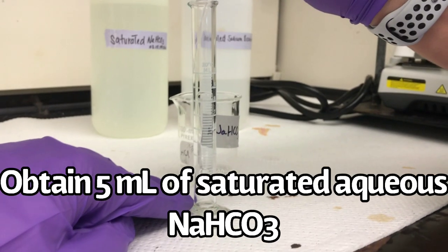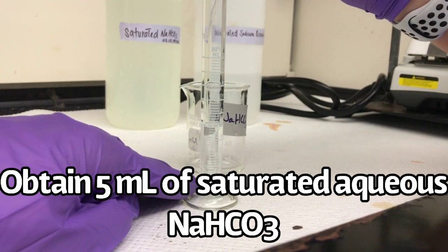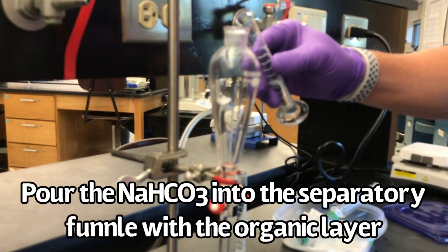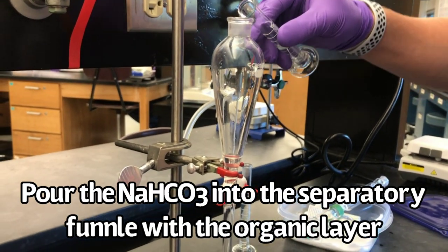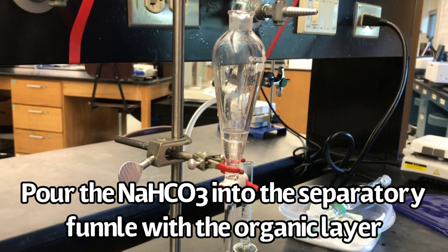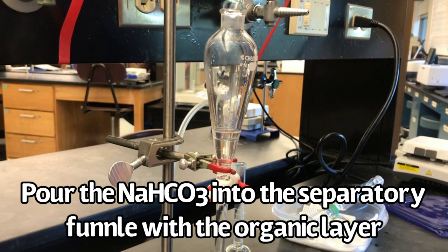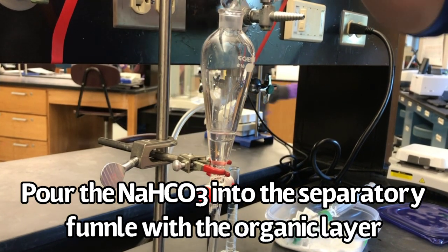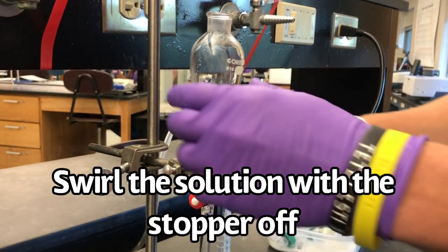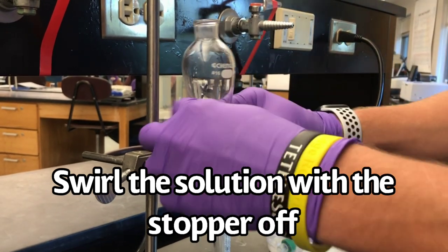Add 5 milliliters of saturated aqueous sodium bicarbonate. Pour the sodium bicarbonate into the separatory funnel with the organic layer. Swirl the solution with the stopper off. This process will remove any residual hydrochloric acid.